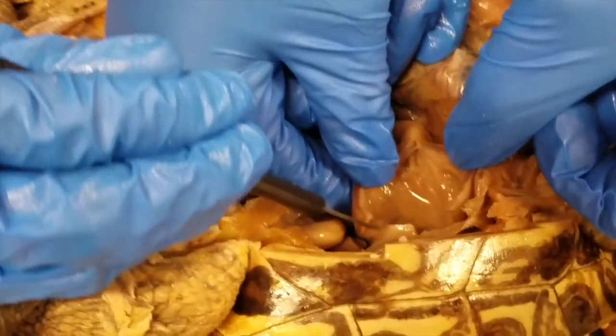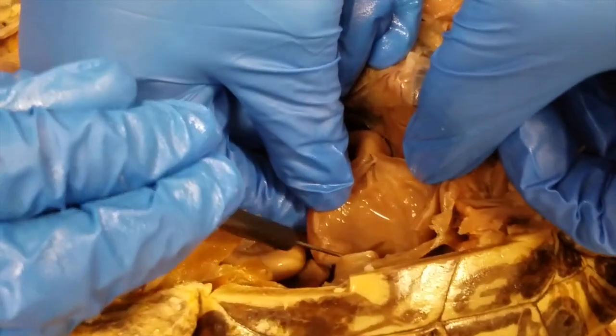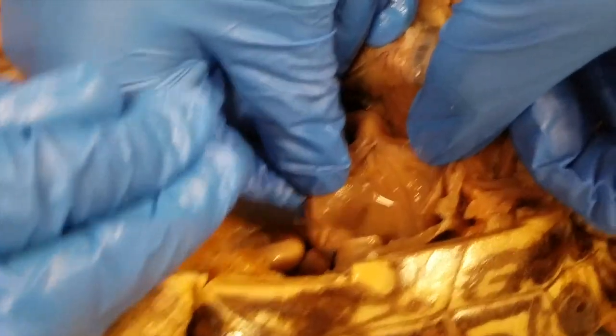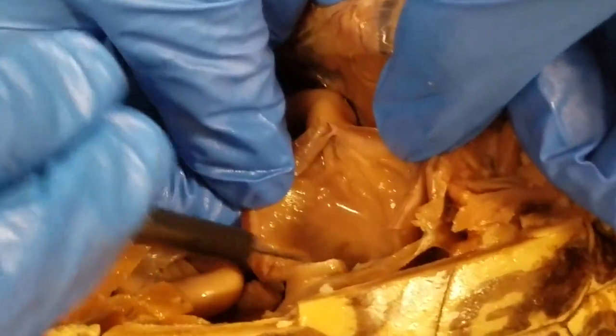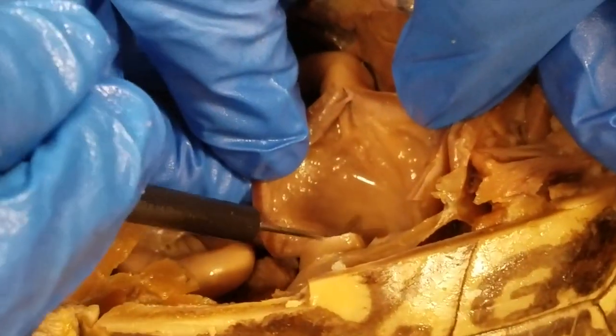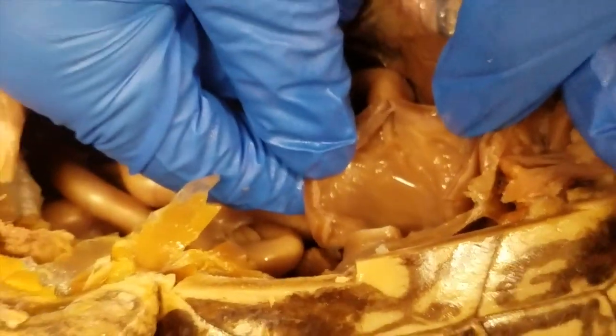This is the stomach once it's been dissected — this is just the inside where digestive juices are expelled in order to help with digestion.